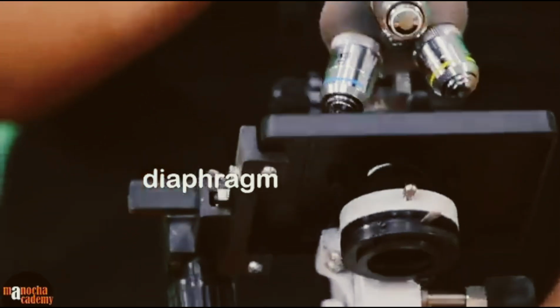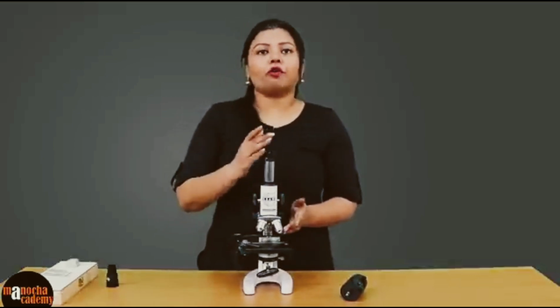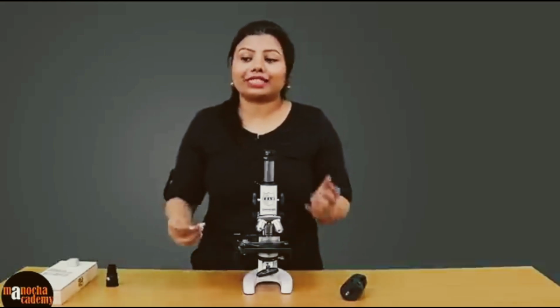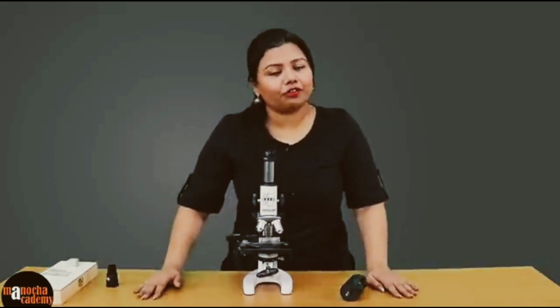Now we have to bring the specimen to the focus of these two lenses. You must be aware that if you have a camera with which you are focusing something which is right in front of you, you cannot use that same camera to focus something which is far away. This I am talking about the DSLR camera. So in that case, what do you have to do?